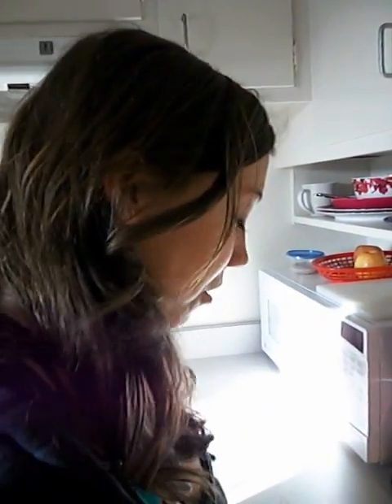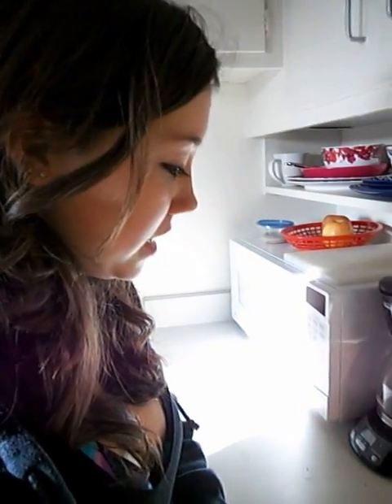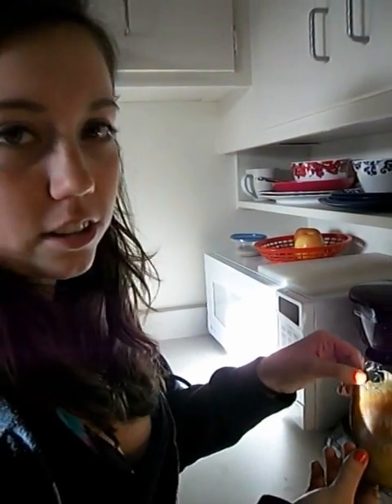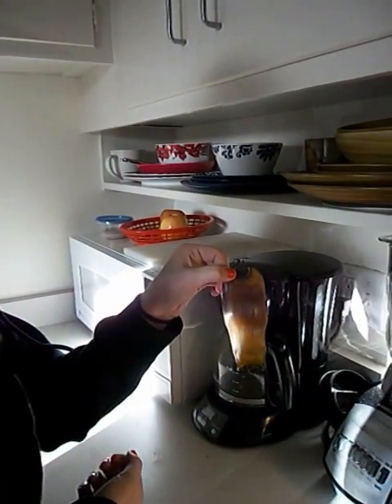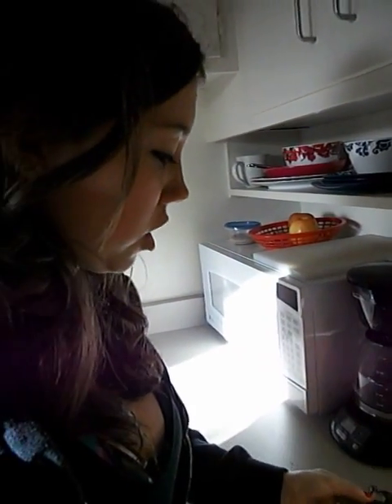I was walking on the beach earlier and there were a lot of mermaid's purses. If you don't know what a mermaid's purse is, it is a shark egg sack. Looks like so. See? Squishy. There's a thing in there — probably a shark fetus.